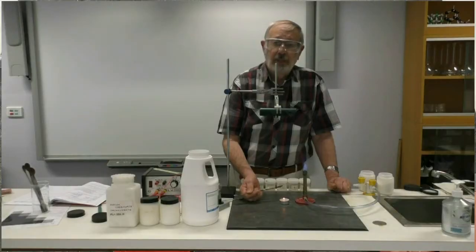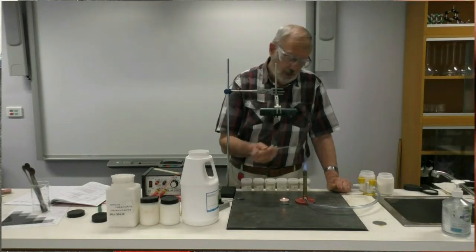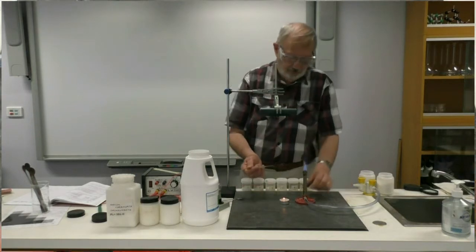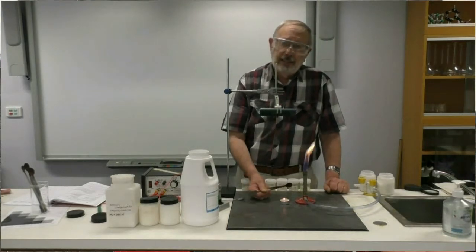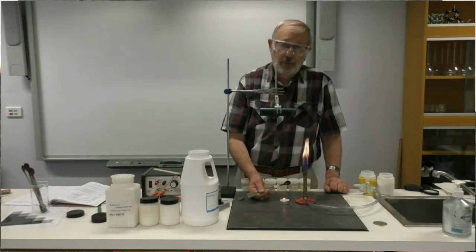The ammonium chloride has broken down into ammonia, a gas, and hydrogen chloride, another gas, and so off it's gone. So what you could say for that one is high melting point.